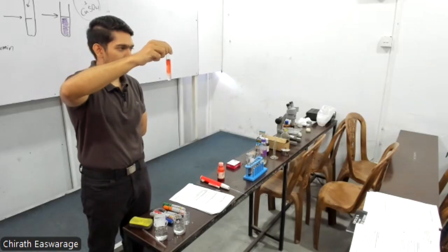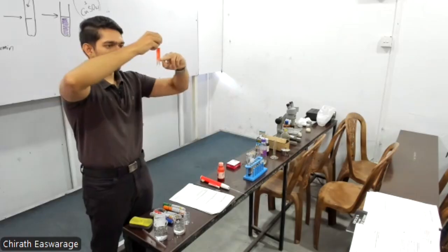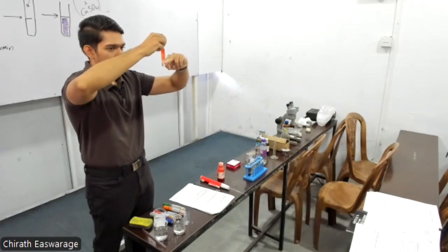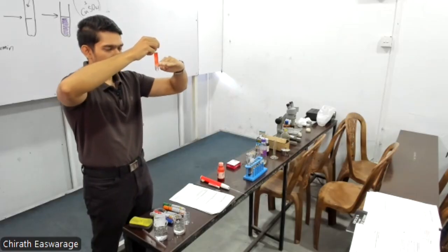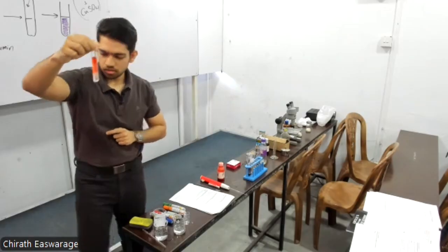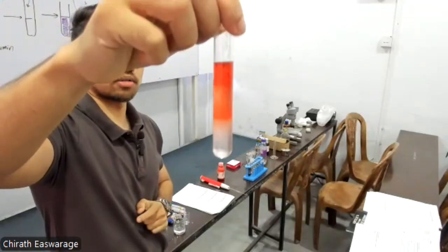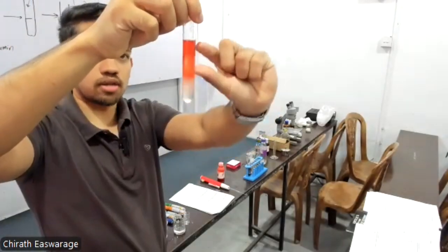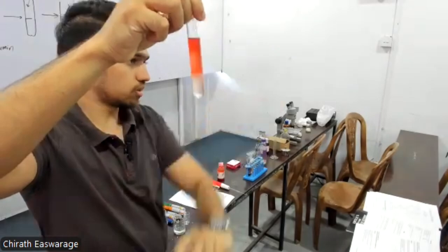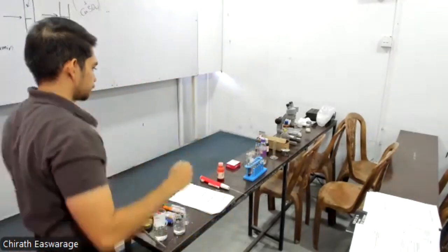Because there's some water in the coconut oil as well, right? But it will take time. With time, the oil will again settle nicely and the colored oil will remain above. Okay? Can you see online? Underneath the oil layer, the below layer is the water layer, and then we have the non-polar oil layer that is being colored by Sudan 3. Simple basic test. Okay?